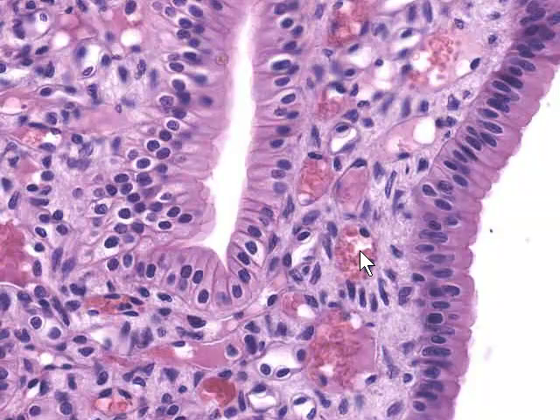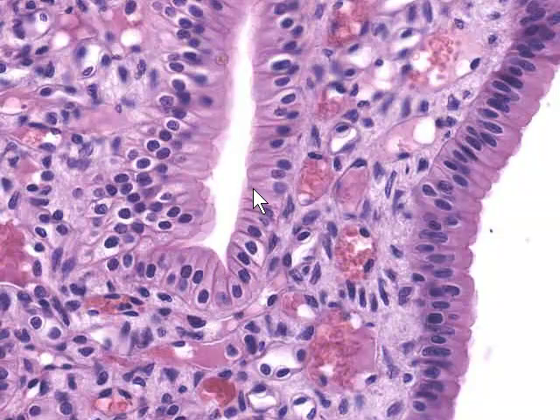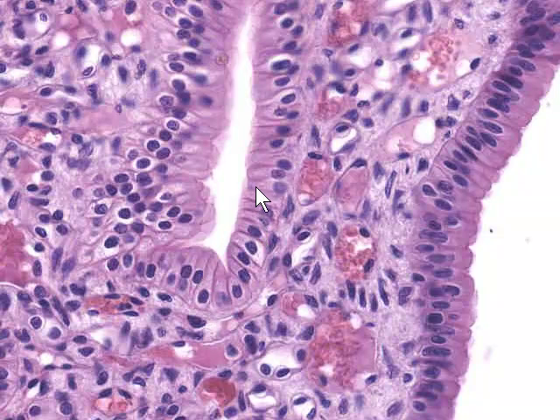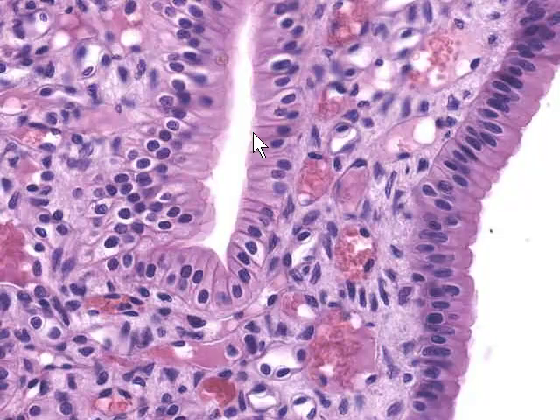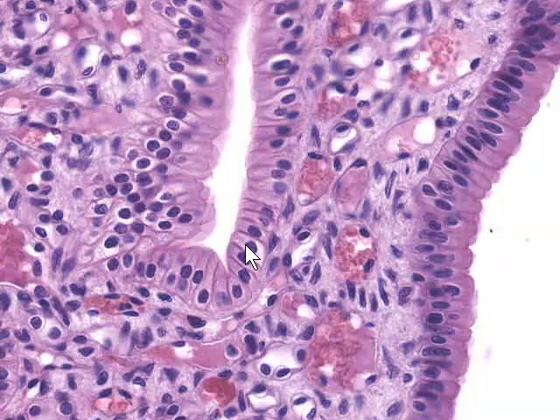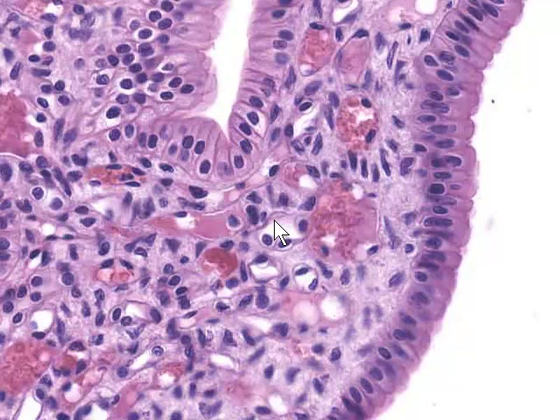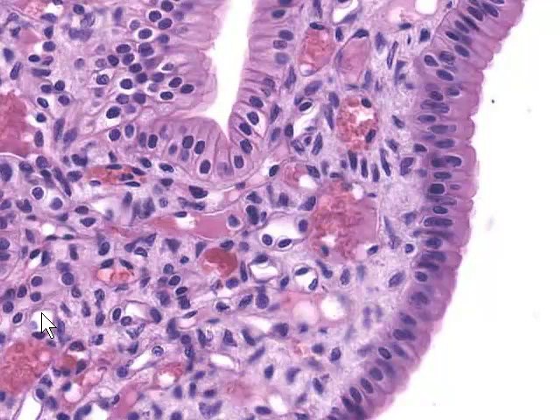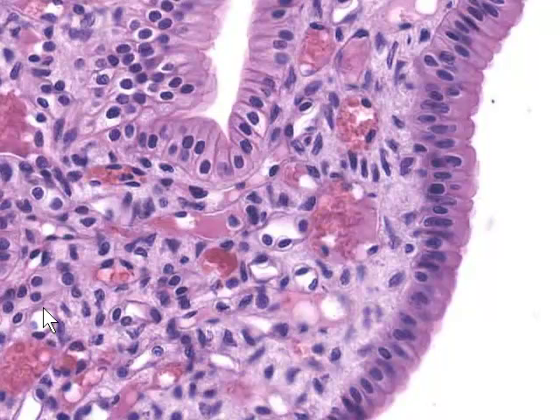At the tip of the medullary pyramid we can see the terminal part of a collecting duct, now lined by a tall columnar epithelium. Some of these cells are almost flask-shaped. Some cells stain reasonably well and others appear clear — in fact there are two different types of cells that make up collecting duct epithelium, though the difference between them isn't hugely important here. Also visible are cross-sections of tubes lined by a simple squamous epithelium. These will be the very tips of very long loops of Henle of juxtamedullary nephrons that extend out to the tip of the medullary pyramid.